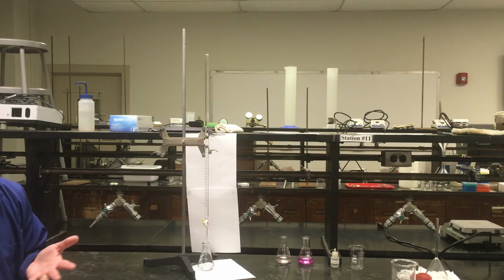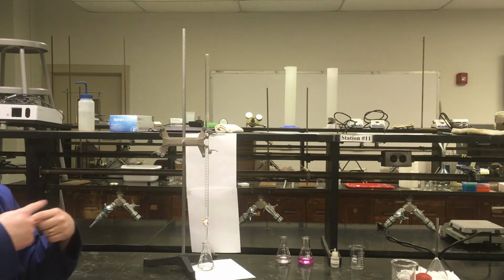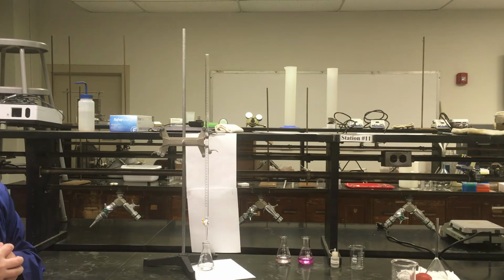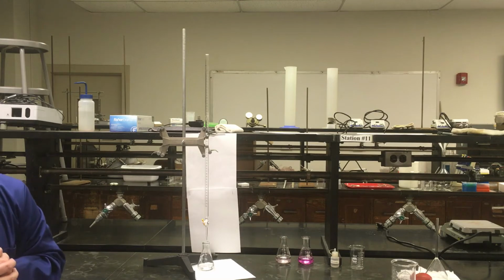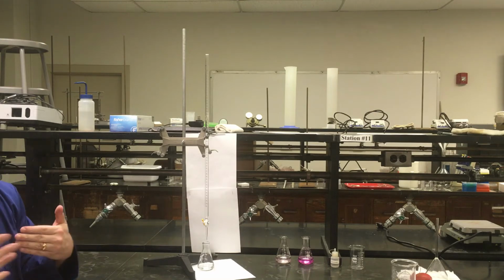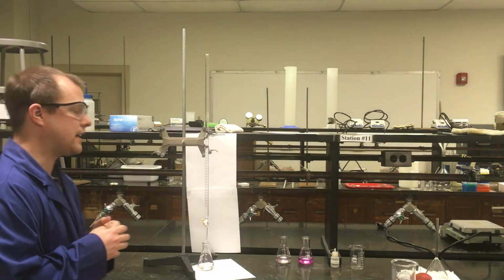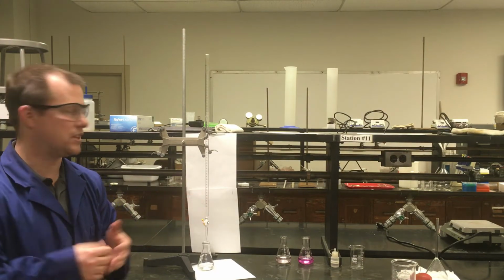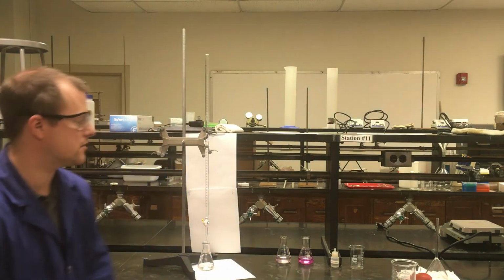Or sometimes, especially if you're taking analytical chemistry or other classes, you may use your first trial as a burned trial, where you just very quickly add and see approximately where the color change took place, so that your future trials you can do quickly, and that may even save you time in the long run. The downside is you could waste reagents if your first trial wasn't very accurate, so keep that in mind. That is something some people will sometimes do. That's how you sometimes can end up with solutions that might look like this color, for instance.